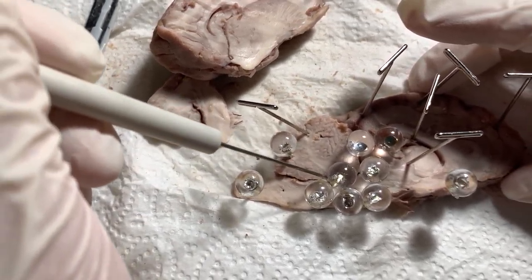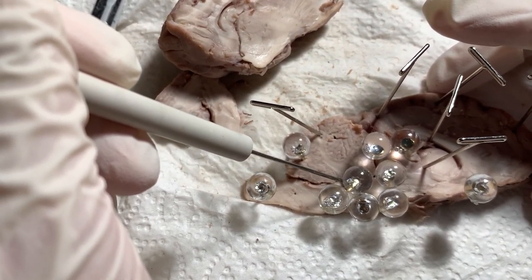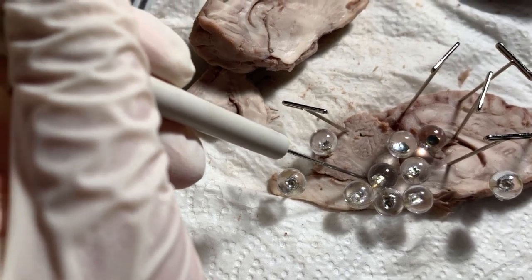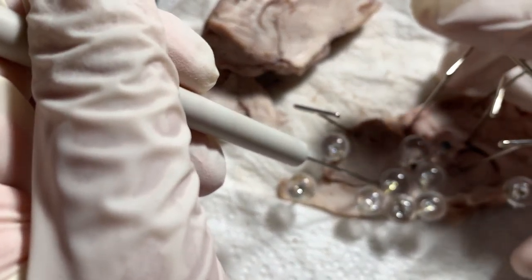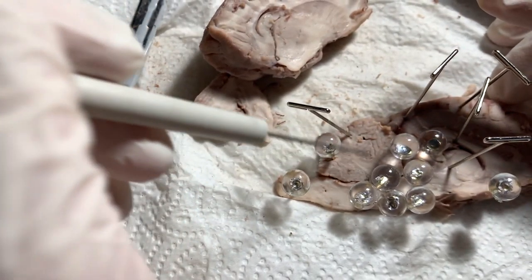Next we have the inferior colliculus, which is the auditory pathway. It is involved in hearing.